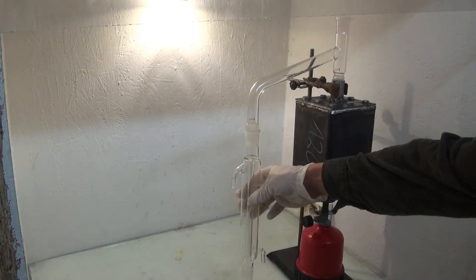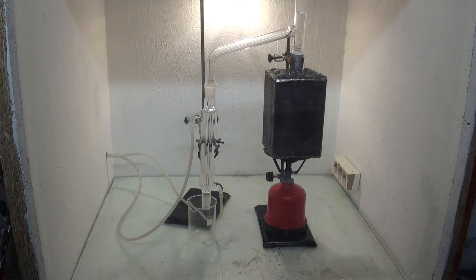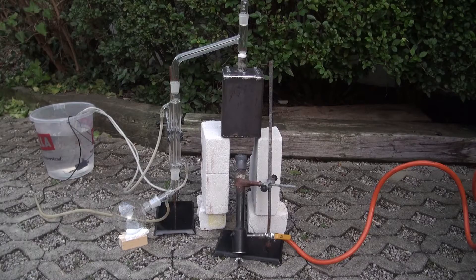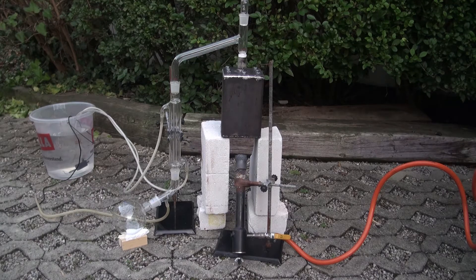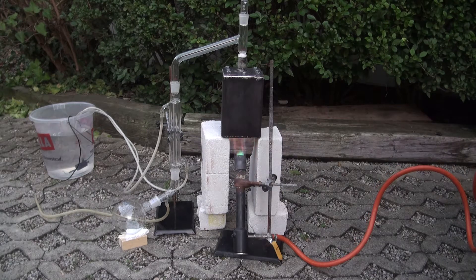I attached a special distillation head, and to that a condenser was added. I tried heating it with a gas burner at first, but this wasn't hot enough, so a metal melting burner was used instead. Bigger is not always better, but definitely when it's about fire.